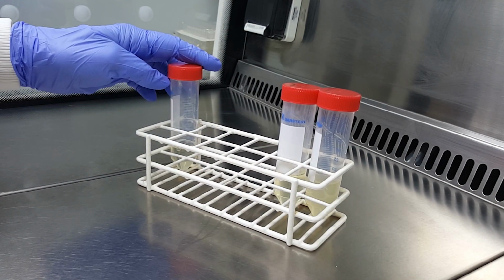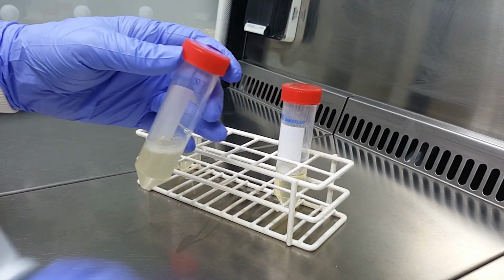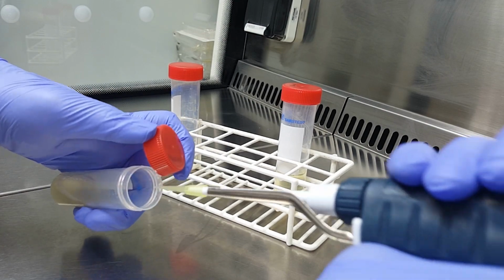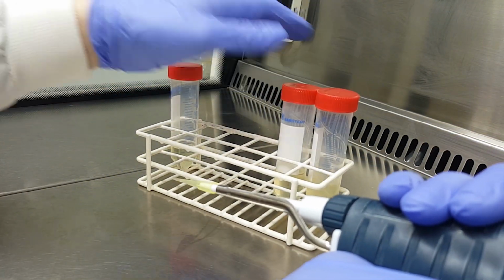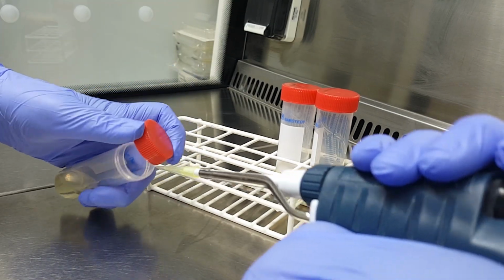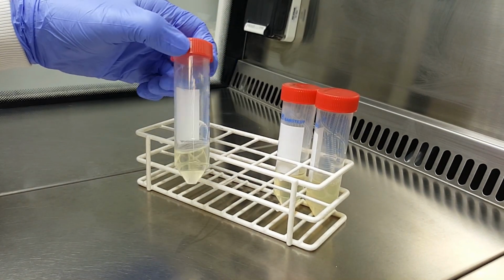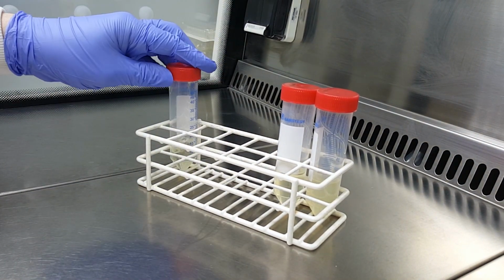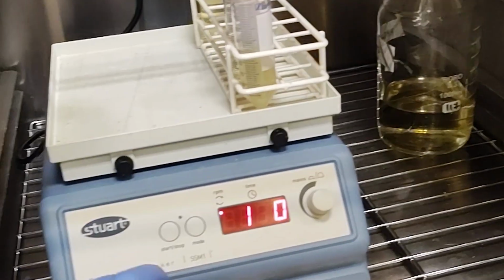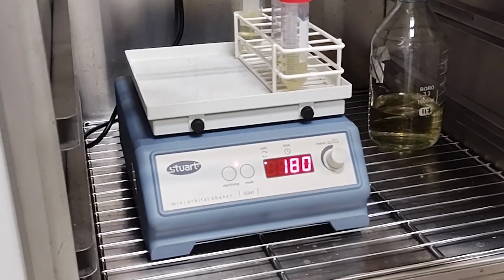Let's make up another tube of sterile growth media and transfer a small amount of our overnight culture. This new culture will take a couple of hours to reach early log phase, so this will give us plenty of time to prepare antibiotics and set up the 96-well plate for the assay. Make sure the amount you transfer isn't enough to make the media go visibly cloudy. Something in the range of 10 microliters in 10 milliliters of broth should be fine. Let's put it in our shaking incubator at 37 degrees and move on to setting up everything else we need for today.